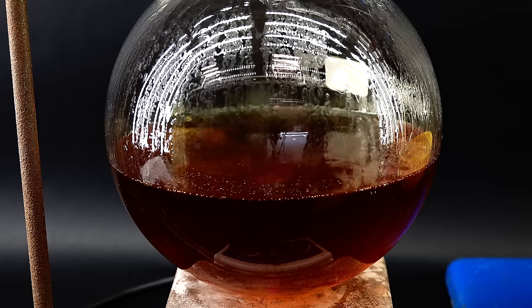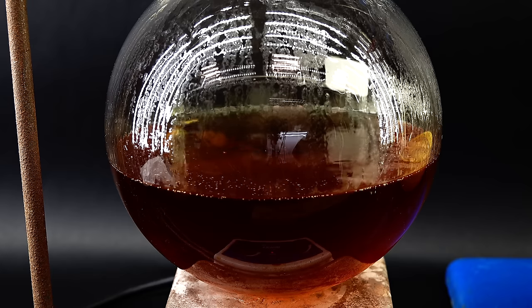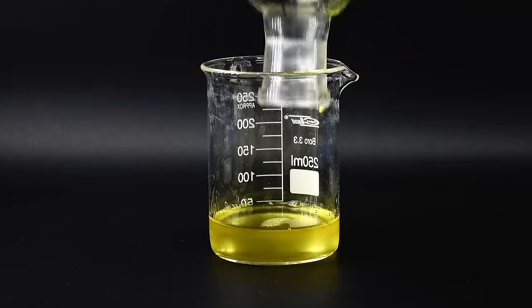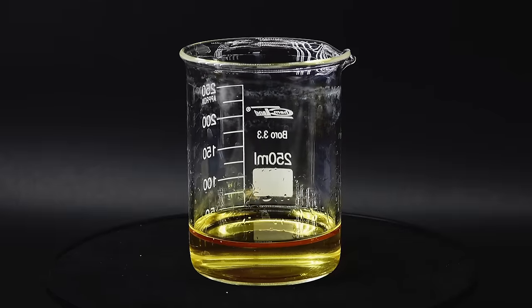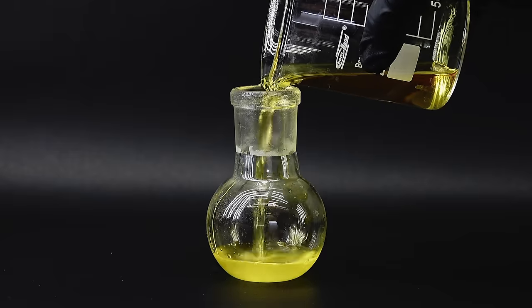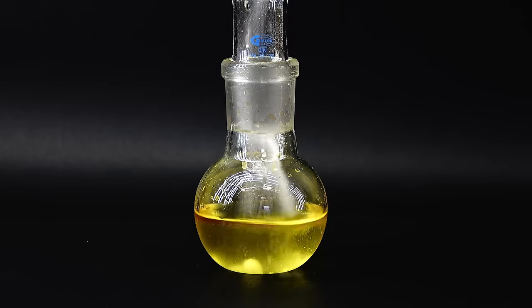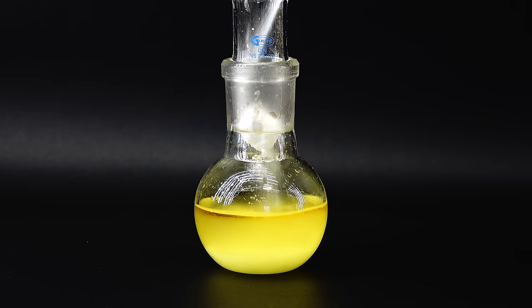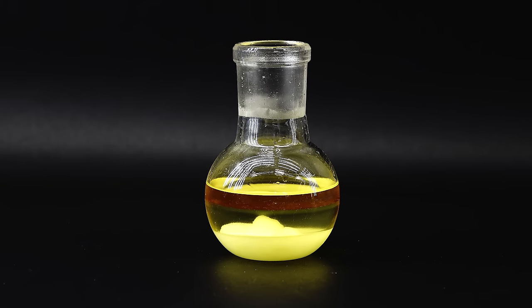Its contents were now even darker than before and it still probably contained some residual diacetyl I could try to recover, but since I already had quite a bit I just didn't bother. This whole distillation left me with about 50 milliliters of some intensely smelling product. It was still mixed with quite a lot of water and before measuring the yield and doing some experiments I wanted to clean it up a little. To do that I got it all into this cute tiny flask and added in 50 grams of anhydrous sodium sulfate, which similarly to before holds on to most of the water and makes the diacetyl far less attracted to it. You can actually see that since the upper diacetyl layer suddenly got much thicker.